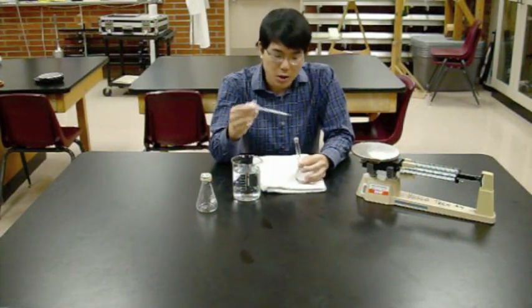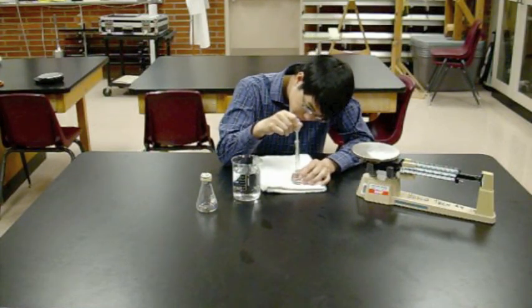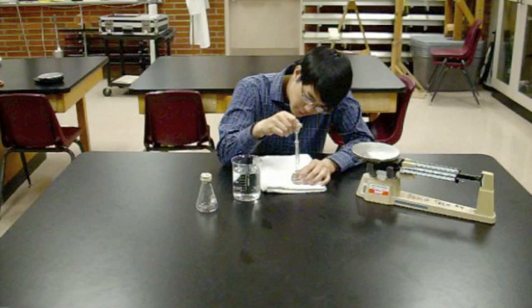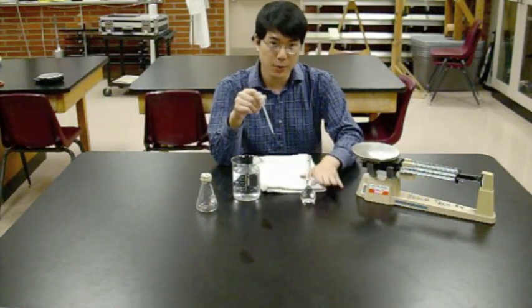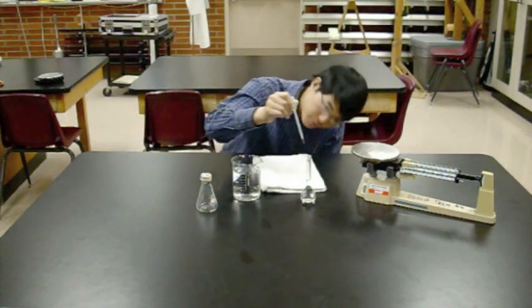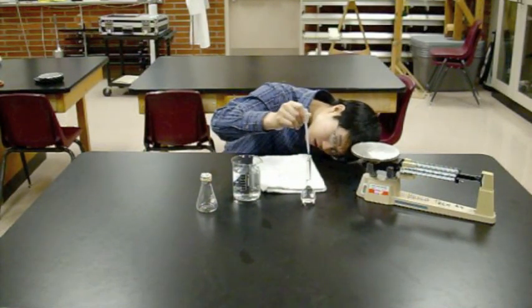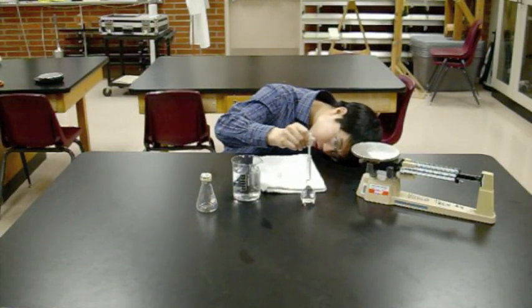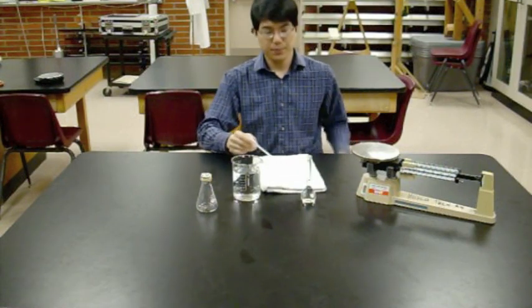This is just a disposable plastic pipette. Just reach down in there. Pull off the right amount of liquid to get you right at the fill line. And it'll help if you're on a rigid level surface when you do that. And you'll want to avoid some parallax error here. So get your eyes at the same level as the scratch. And there you have it.